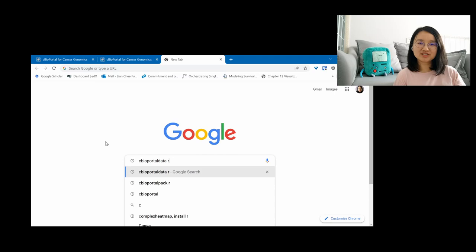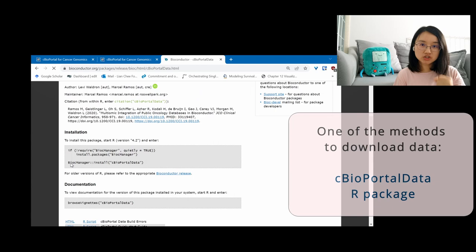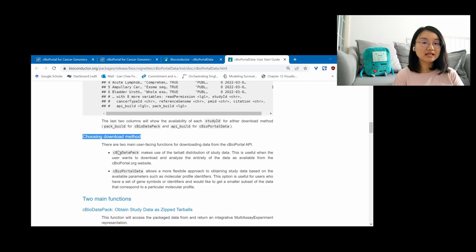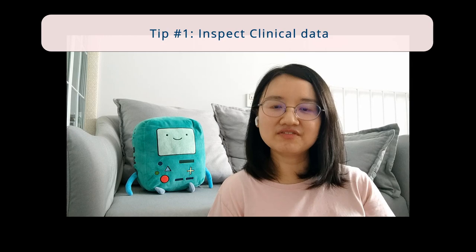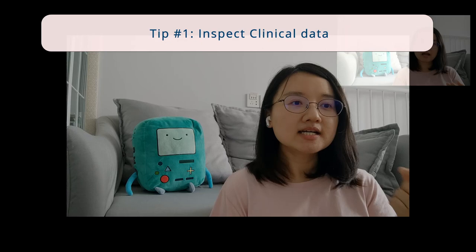That's why it's good to do it from scratch, knowing what type of dataset you need and how to clean and group them accordingly. The good news is cBioPortal also provides a way to download datasets that have been processed nicely so we can use them directly. If you want to download the data yourself and do the data cleaning and transformation, here I have three tips to make things easier. First, start by looking at the clinical information — the download tab always has one file about clinical information.